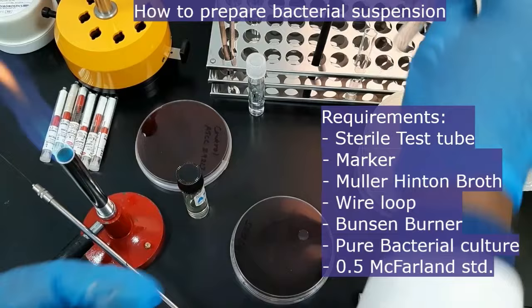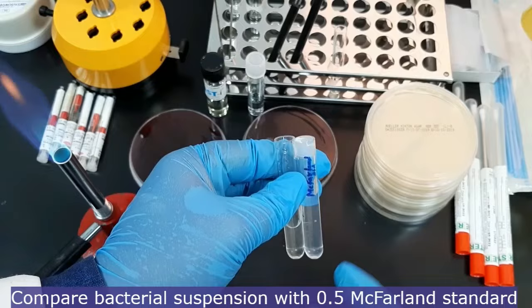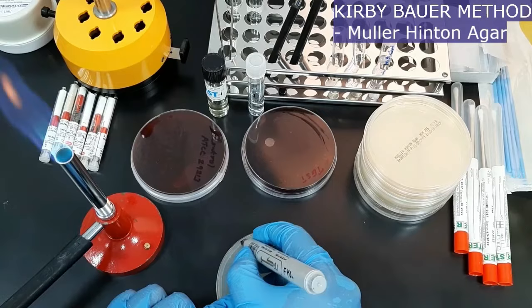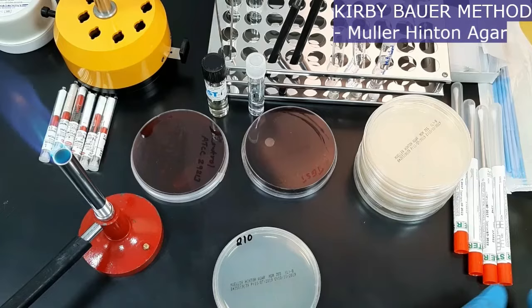Once the bacterial suspension is prepared, compare the bacterial turbidity with the 0.5 McFarland standard. The next step is to label the Mueller-Hinton agar plate with the test culture details or with identification numbers.